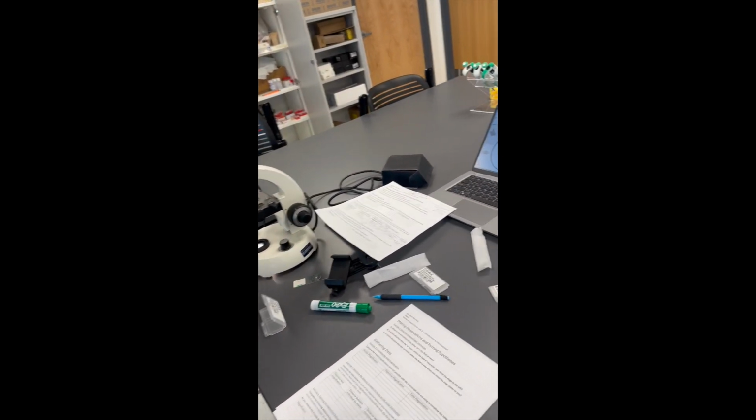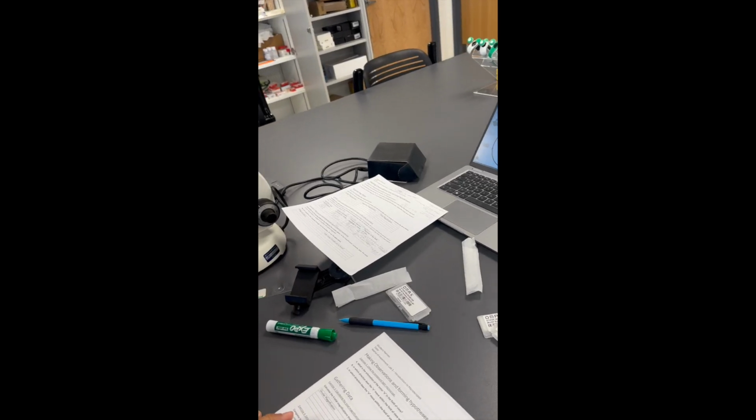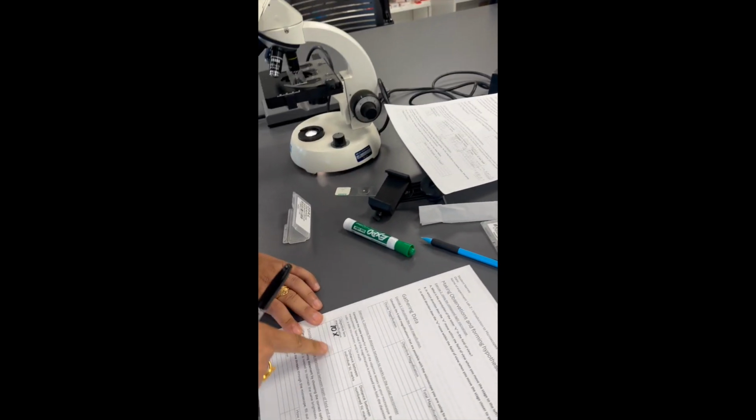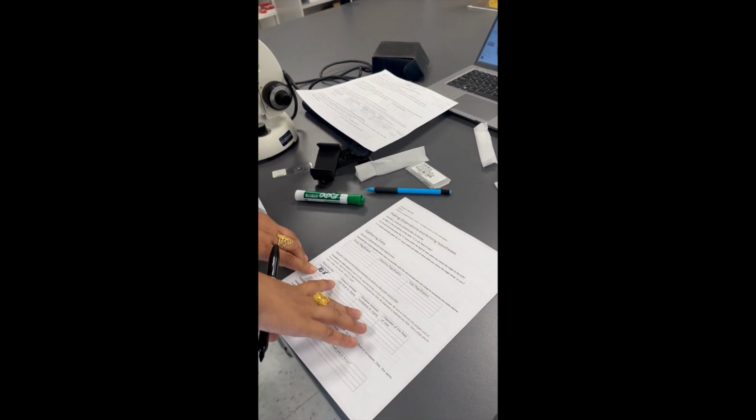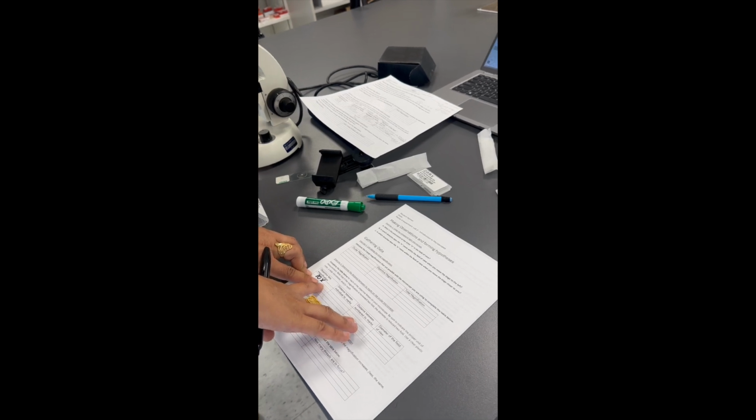So the first measurement that I'm going to go for is at 10x. So this table here is asking students basically to calibrate their tick marks on their ocular lens, on their ocular micrometer, by using the stage micrometer. So at 10x, I'm going to measure the distance between individual tick marks and the distance between numbered tick marks, which would be a 10-fold difference between these two, by looking at the stage micrometer.